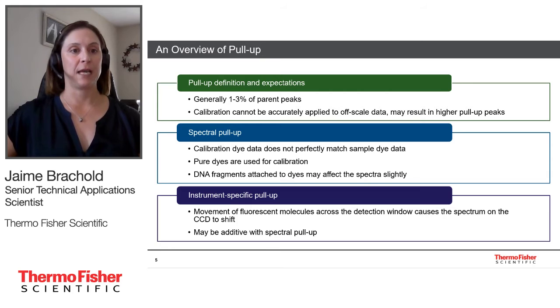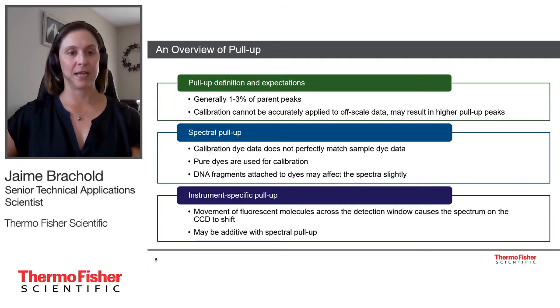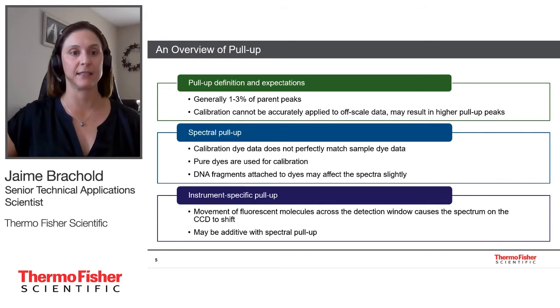When we talk about pull-up, there are really two different types of pull-up. There's spectral pull-up and there's instrument-specific pull-up. Spectral pull-up occurs because when we run our manual calibration, we're using pure dyes. The matrix for deconvolution that is generated from that pure dye calibration then gets applied to our samples. Well, in our samples, our dyes are attached to DNA fragments, and that could affect the spectra differently. So the difference between the spectra from the dyes being attached to the samples and the dyes being pure dyes, that difference is what causes the error that causes spectral pull-up. In the raw data, spectral pull-up, you can see a pull-up peak that sits directly centered under the parent peak, and the same is true in the analyzed data.